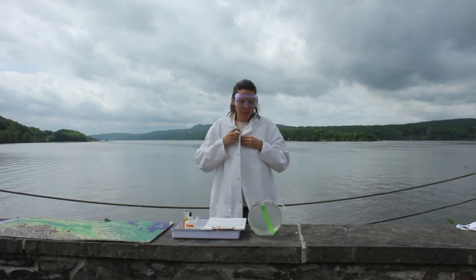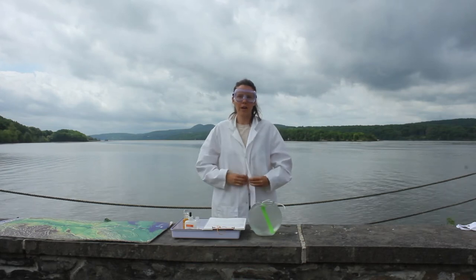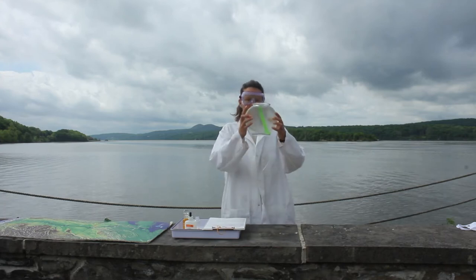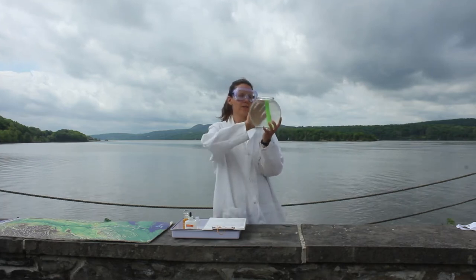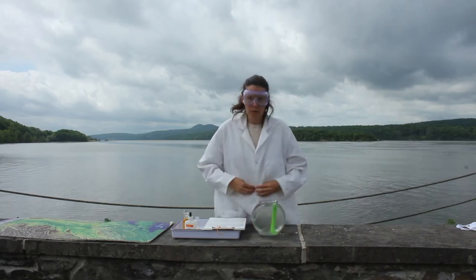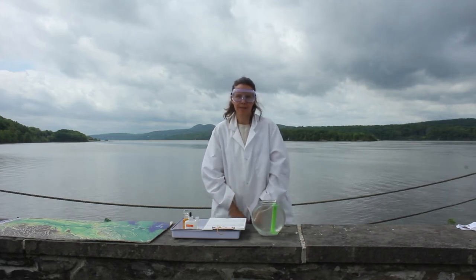Alright, so today we are looking at two important parameters of water. I have here a tank of water from the Hudson River and you can see that this water is fairly clear. But there are some important things in this water that make life possible for animals like fish and plankton.